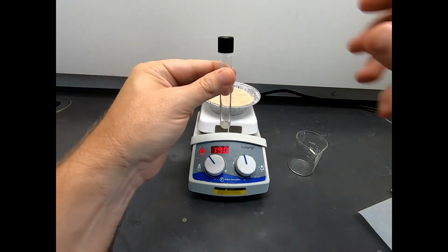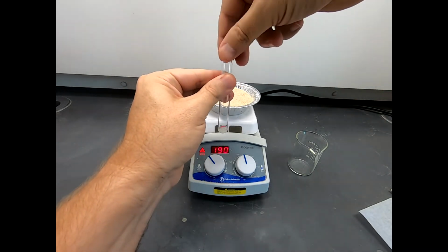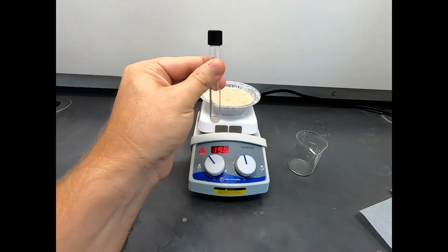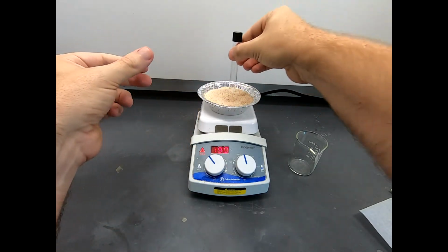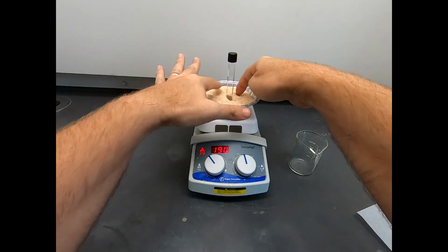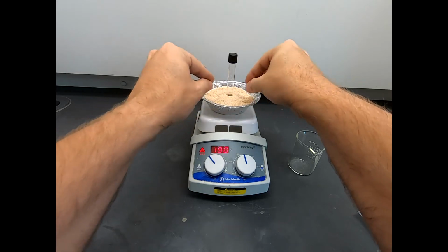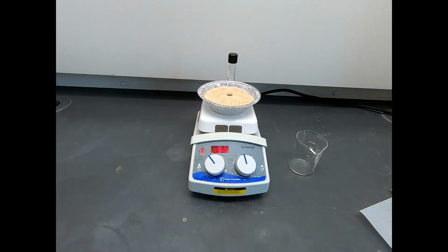because that's what the reaction calls for. Now this is our complete setup. I'm not going to tighten these threads down. I'm going to keep this loose, and I'm just going to take this whole mixture, put it in the sand bath, and you could probably clamp that if you were interested, but that's pretty stable. Push that sand up around it, and we're going to let that heat.